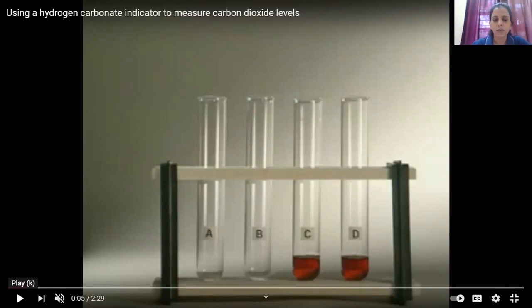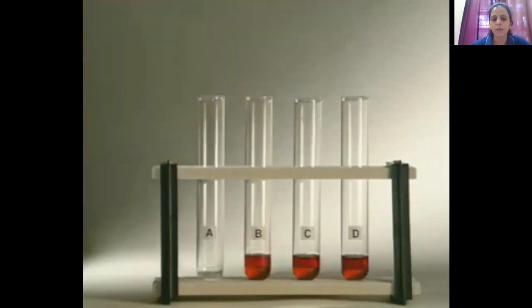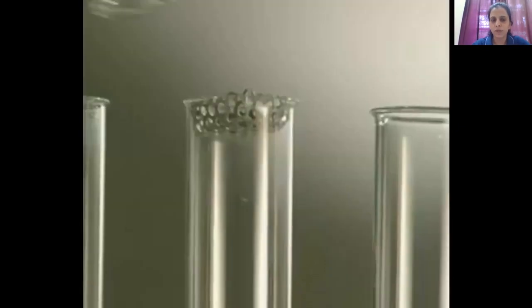Okay, and you have to perform this experiment by taking 4 test tubes, and these test tubes are labeled as A, B, C, D, and in all these 4 test tubes you have to add 5 or 10 ml of hydrogen carbonate indicator. And you can make out here in the video the color of hydrogen carbonate indicator is reddish orange.